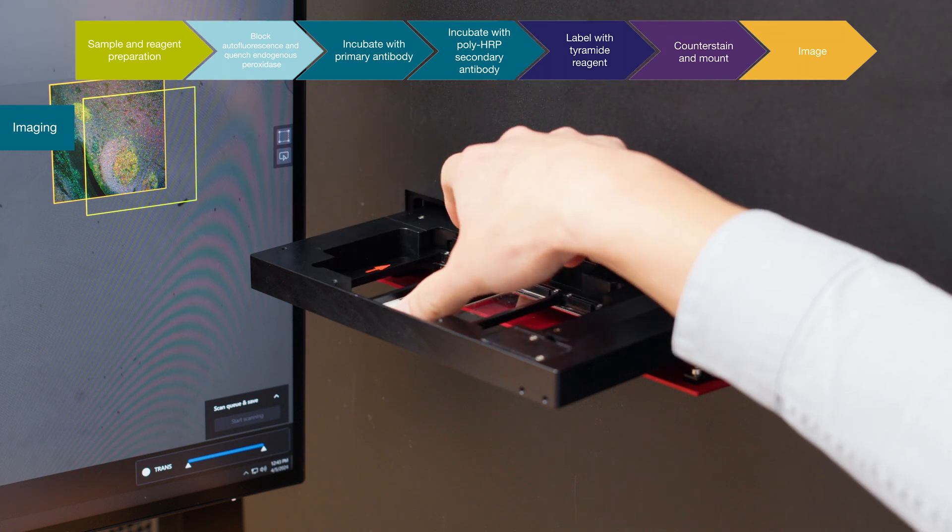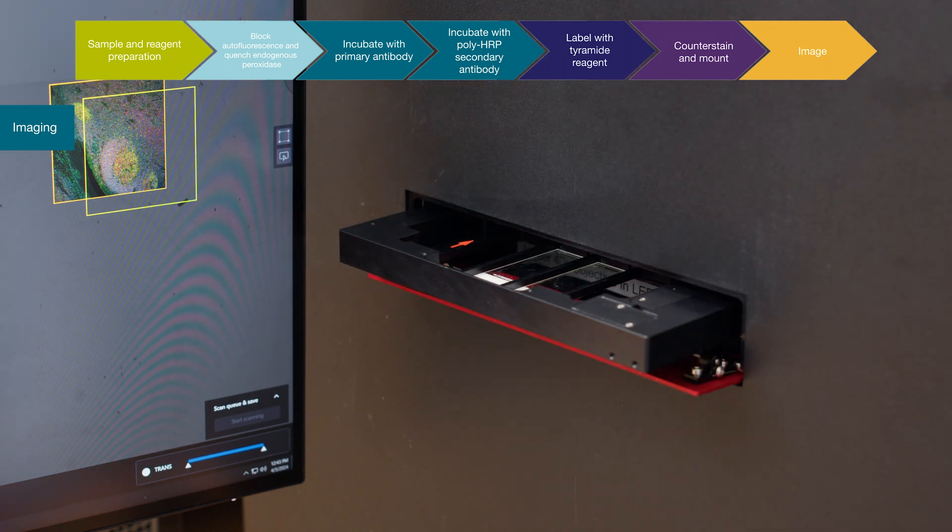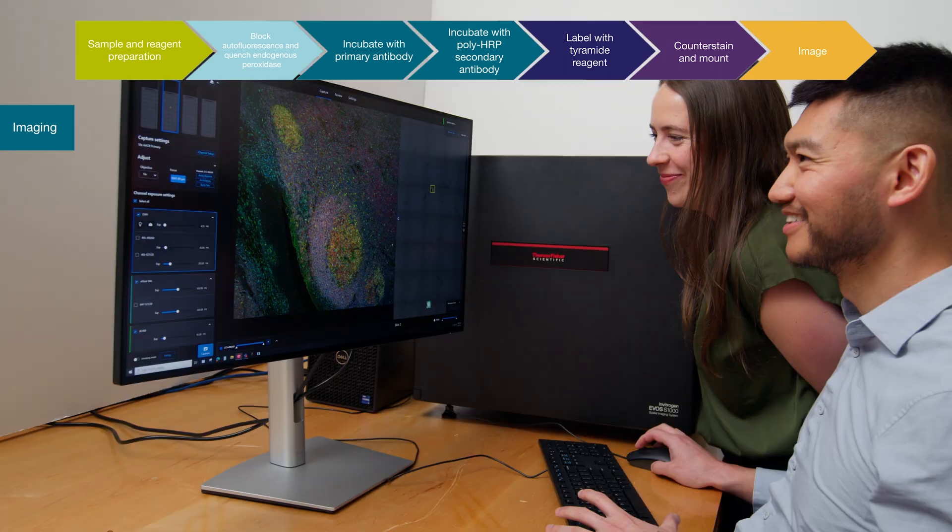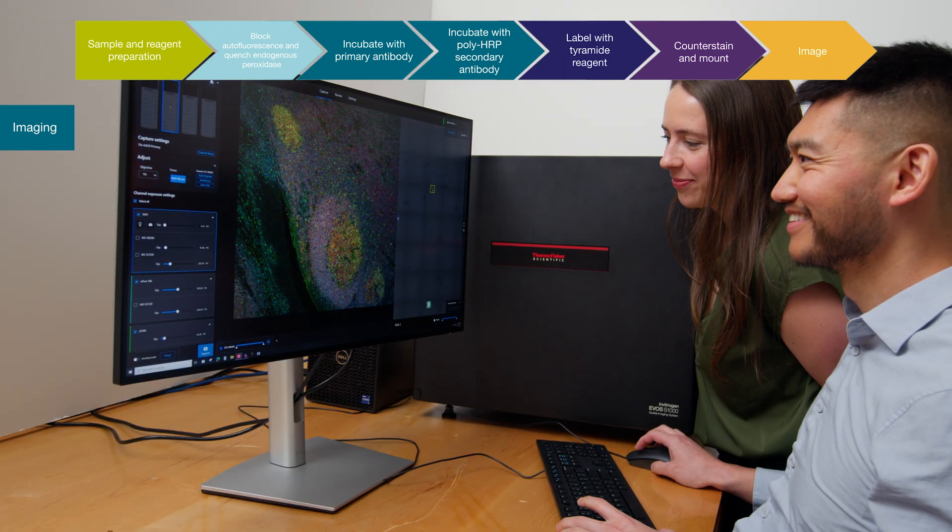Finally, your samples are ready to image using a fluorescent microscope. Using the EVOS imaging system, beautiful images can be captured.